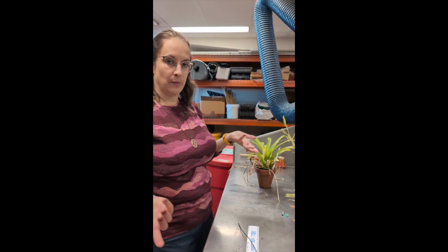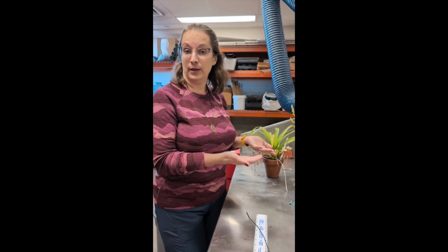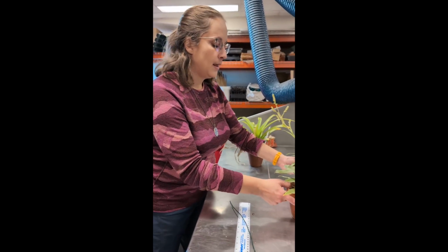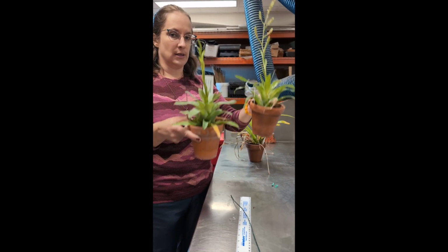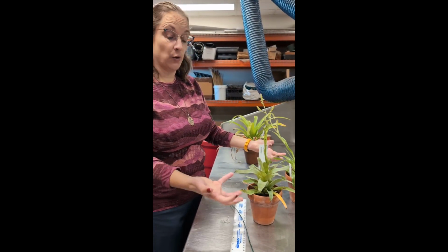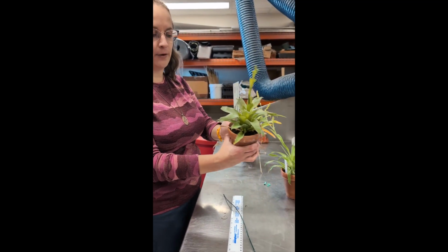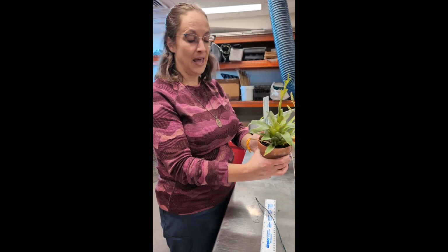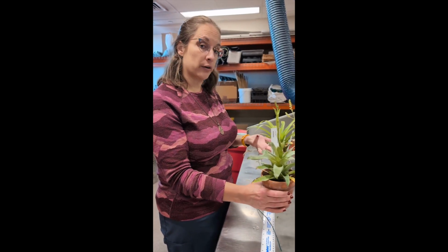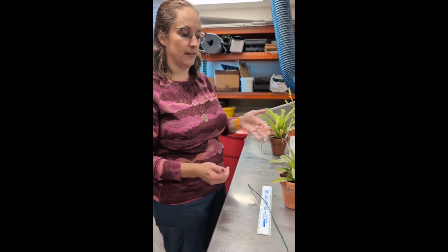Well, if you just want to know how big something is, you could weigh it or mass it on a balance or something like that. But it's going to be a little tricky if we wanted to compare these two plants, because much of the weight, and I can feel it as I'm holding it, is coming from these pots and from the soil that they're in, and that's holding a lot of water. So it could be the case that this was much more recently watered than this one.